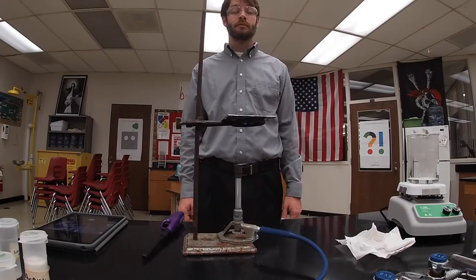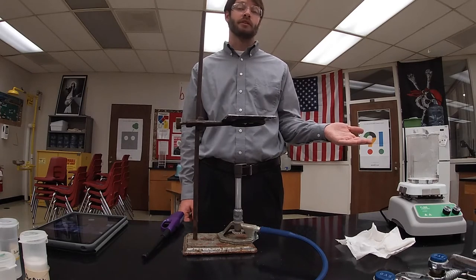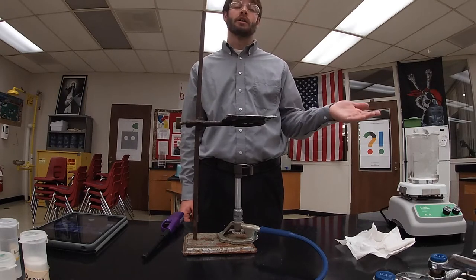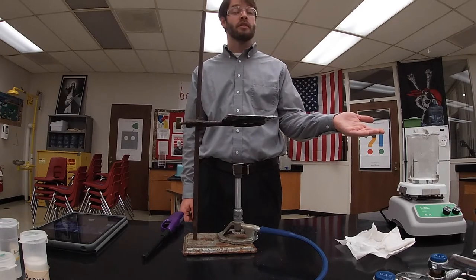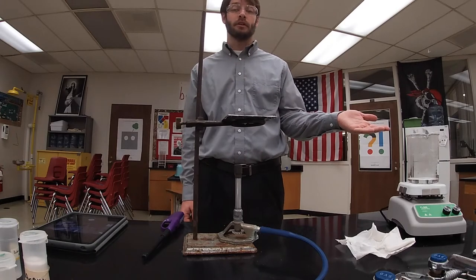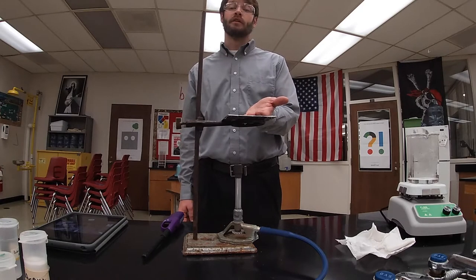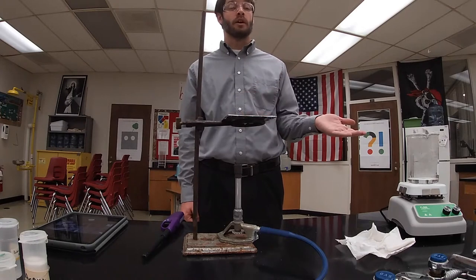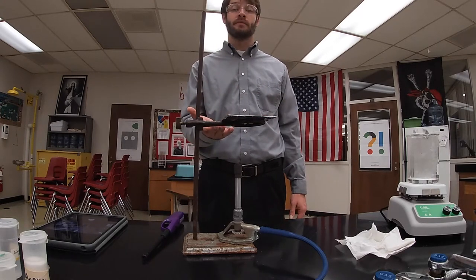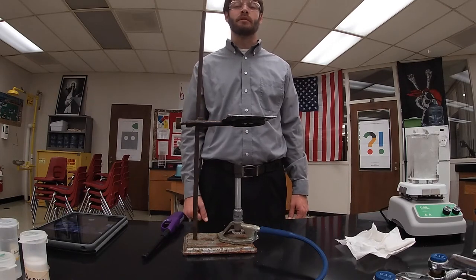If our samples melted over the boiling water, then we know the melting point must be between room temperature — roughly 25°C — and the boiling point of water, 100°C. If they did not melt over the boiling water, the melting point must be greater than 100°C. If samples did not melt over the boiling water but melted over the 500°C flame, the melting point is between 100 and 500°C. If the sample did not melt over the 500°C flame, then the melting point is beyond 500°C.